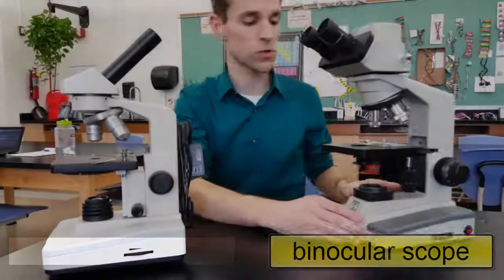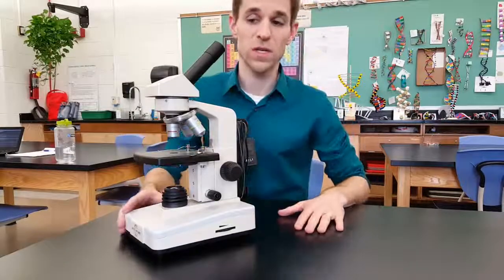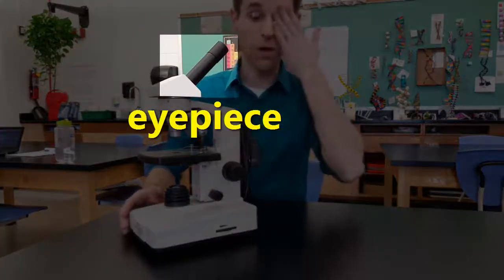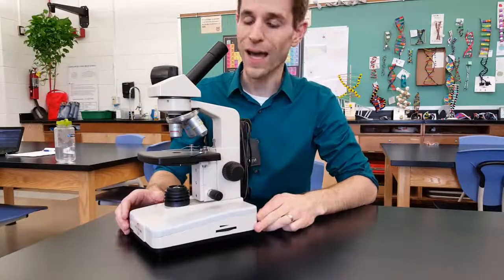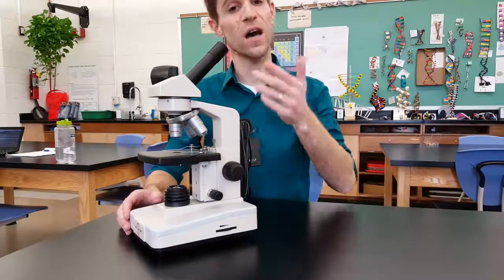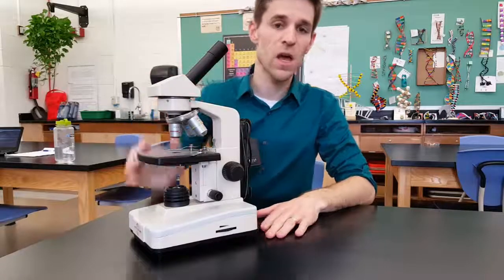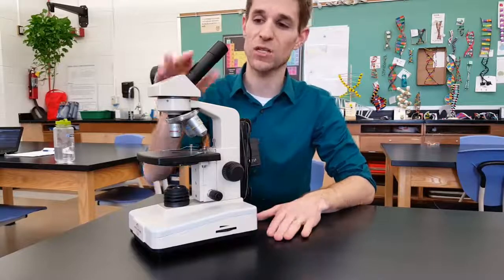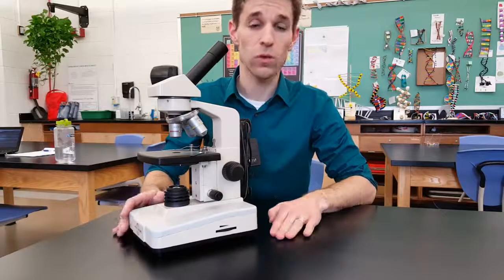I'm going to put the binocular scope away and focus on our student scope, because this is the one you're going to be using. This is the eyepiece right here — this is the part that you look through. You must cover one eye or squint or close one eye in order to look through with the other eye. This eyepiece has a magnification of 10x. So if you just looked through this without the lenses down on the scope, you would magnify your specimen just ten times.